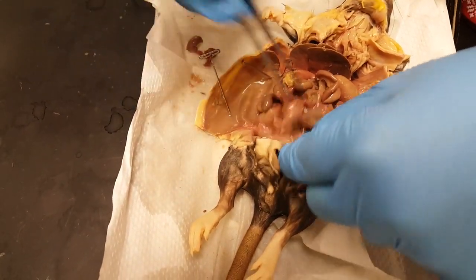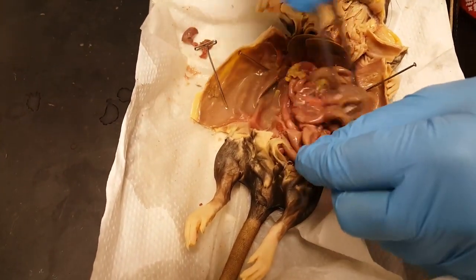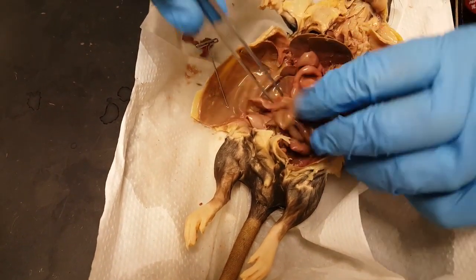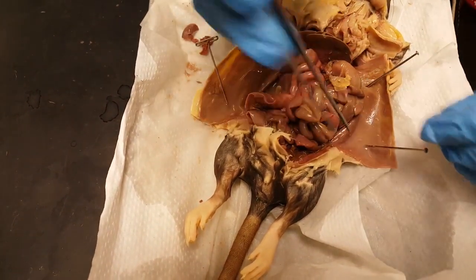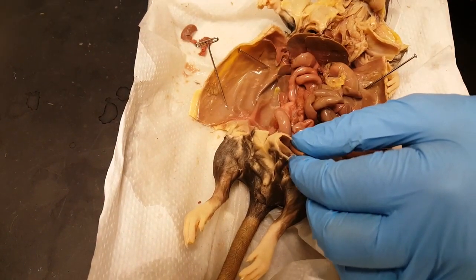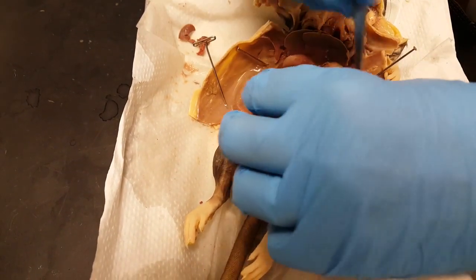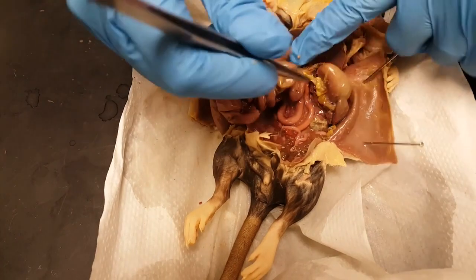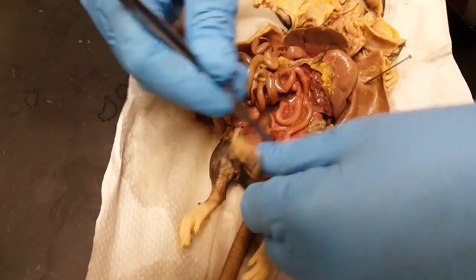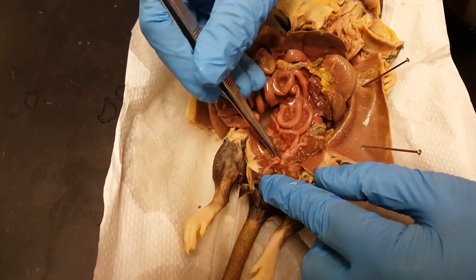Then as we follow the cecum up, it now becomes the large intestine, and the large intestine goes up, over, and down. This is the ascending colon, this is the transverse colon, and this is the descending colon that leads out here at the rectum.